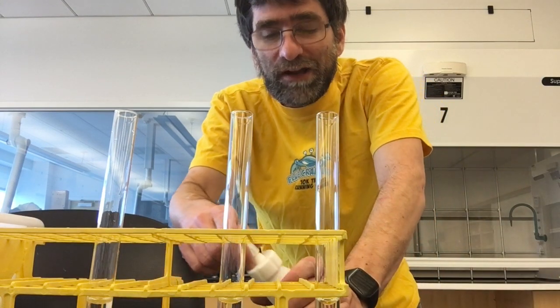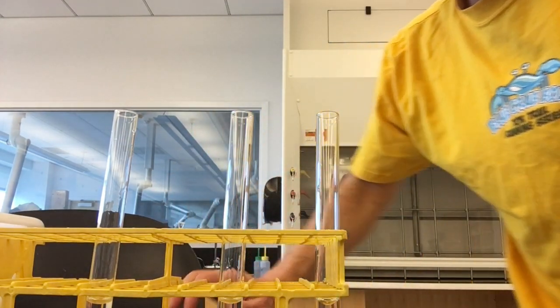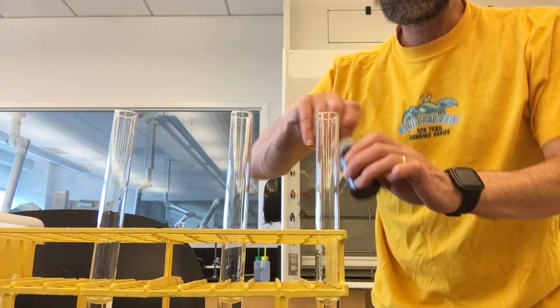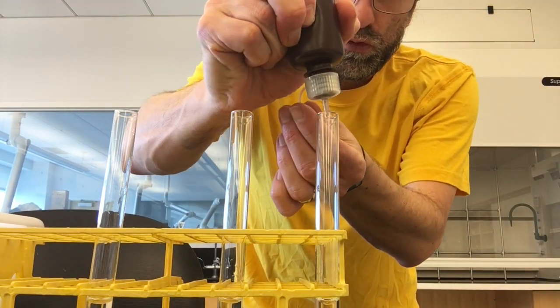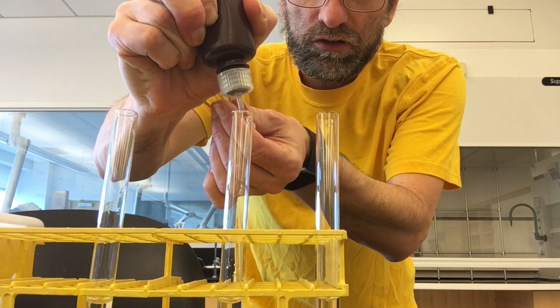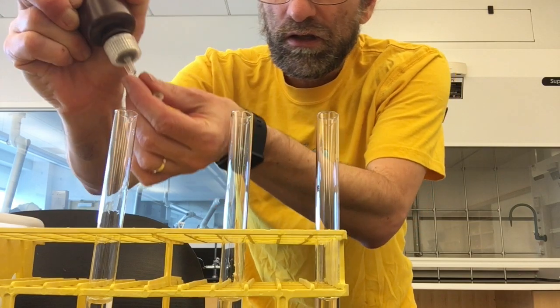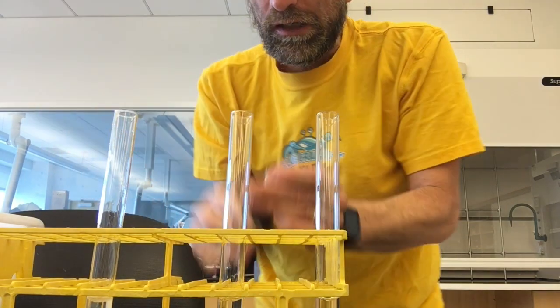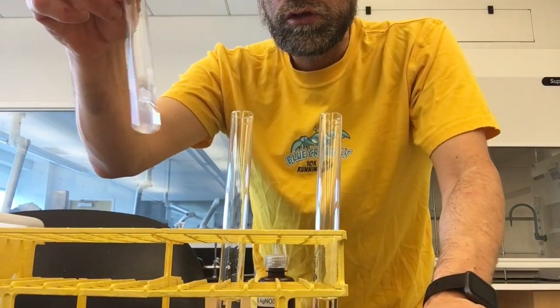I'm going to add five drops of silver nitrate to each of them. So this is silver nitrate — I'm going to add five drops to each of the three test tubes.